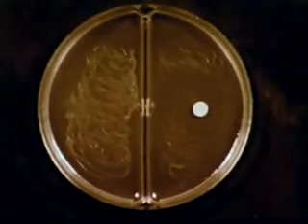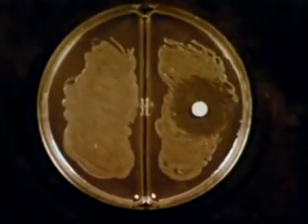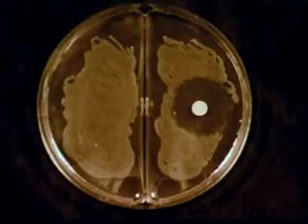During that period, seen here in time-lapse photography, the bacteria multiply and become visible as large colonies, everywhere except in the area around the paper disc. The clear zone shows that bacterial growth has been stopped. This inhibition is due to the sulfanilamide diffusing from the disc. How does sulfanilamide stop the growth of a cell?